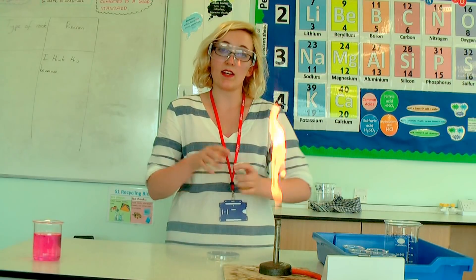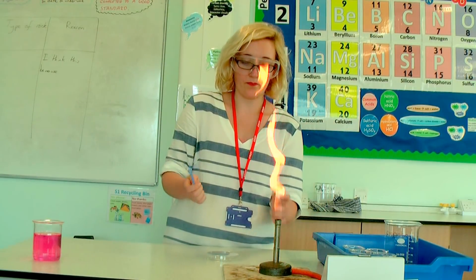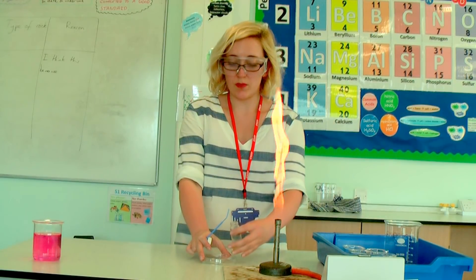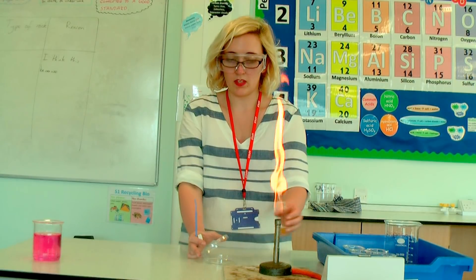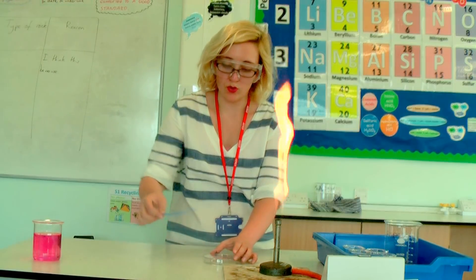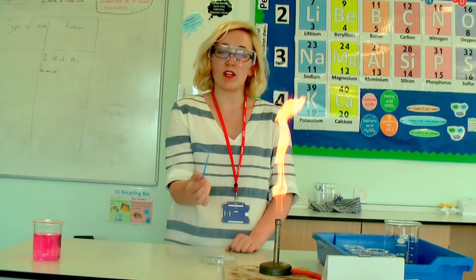Once you have labelled up your plate, it's time to spread your bacteria. The bacteria will usually come in a sealed container. It's important we do this quickly so we don't contaminate the air around us. Decontaminate your spreader by passing it through the flame, then lift up the lid of your E. coli and the lid of your petri dish — keep the dish tilted towards the flame so bacteria can't get in — and pour a little bit on the surface. Flame the top, put the lid down, and close. Now draw your spreader around the plate so the E. coli covers the agar jelly entirely, then disinfect the spreader.